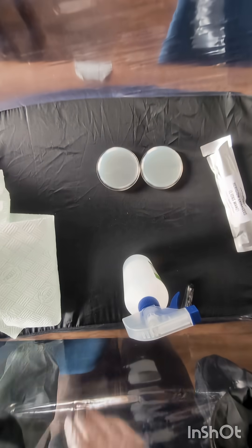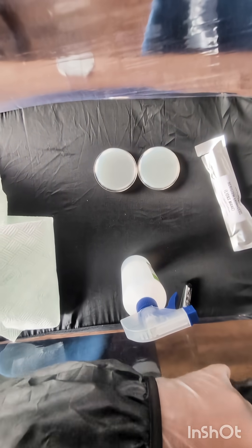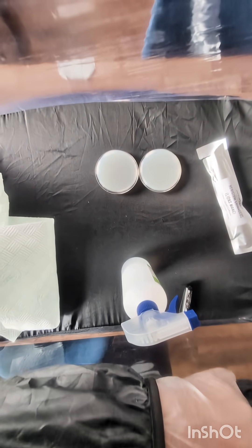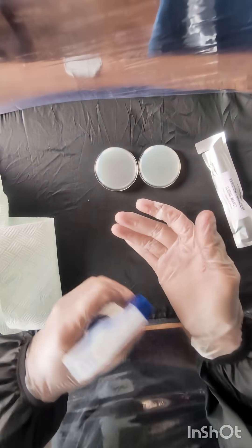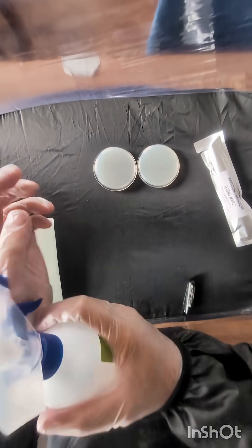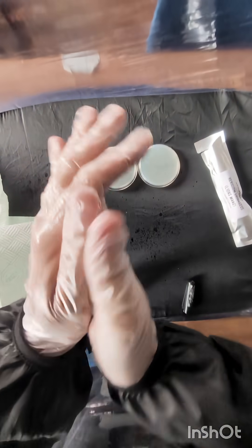So let's have a look at how you can do this. You want to kick things off in a still air box — if you don't have a laminar flow hood, a still air box will cost you about 20 quid off Amazon. It stops the air moving and prevents any nasty bits from contaminating your petri dish. Cleanliness is godliness, and 'grow a mean, keep it clean' is what we always say.